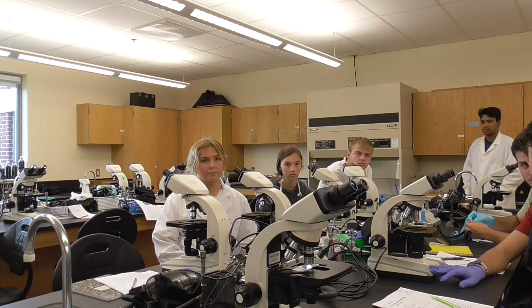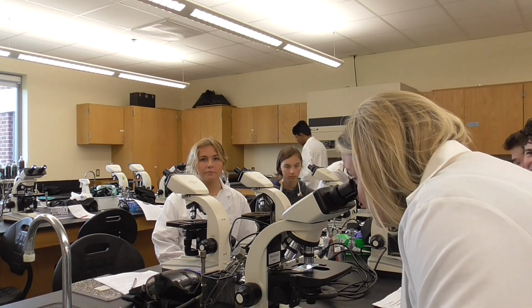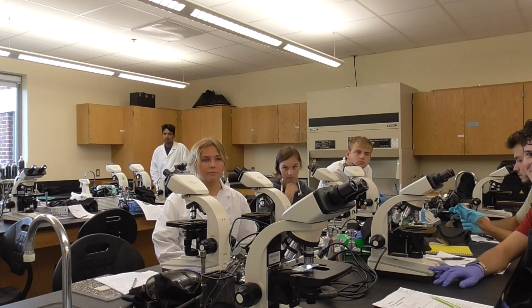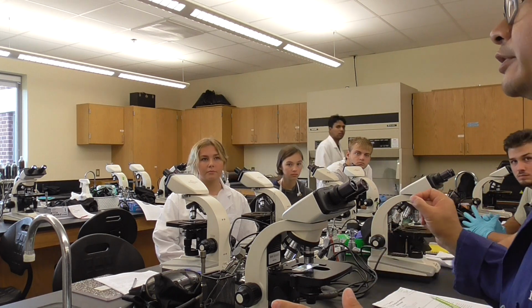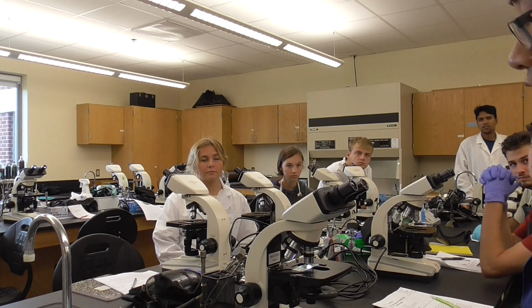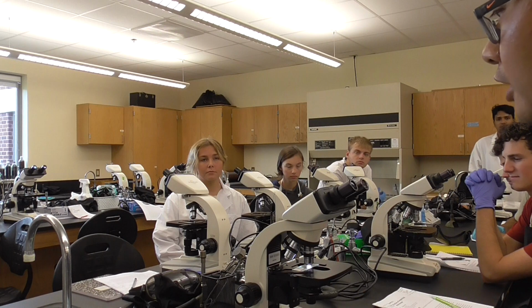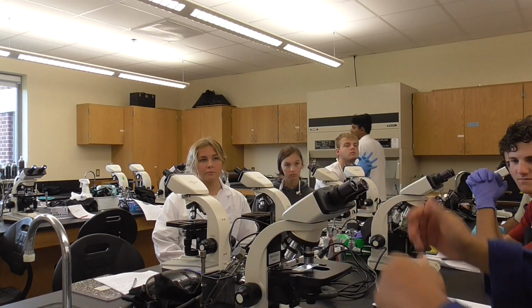Come here to see it. It's your turn. Can you see it? Yeah. That's what you do. Now what you're going to do is draw the picture of what you find in your notebook. And if you have a cell phone, even though it's difficult, you can take a picture like this, and just print it out and put it in your notebook. This will be the first trial of using your microscope.